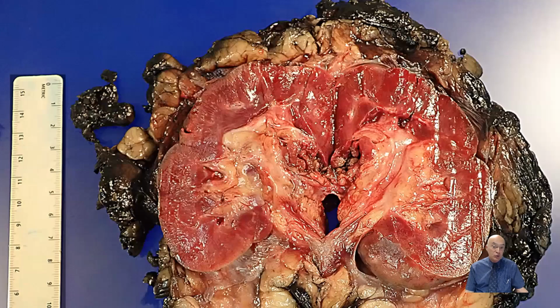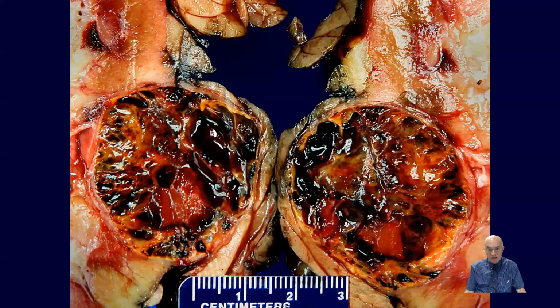The differential diagnosis could be urothelial carcinoma in the pelvis versus a tumor that is closest to the hilum in the renal parenchyma. So this is something that has to be very well examined, and representative sections need to be produced correspondingly. And also see if the tumor is going into the ureter, as you can see here. Apparently, the tumor is not peripheral, so there is no concern about capsular involvement in this particular section.